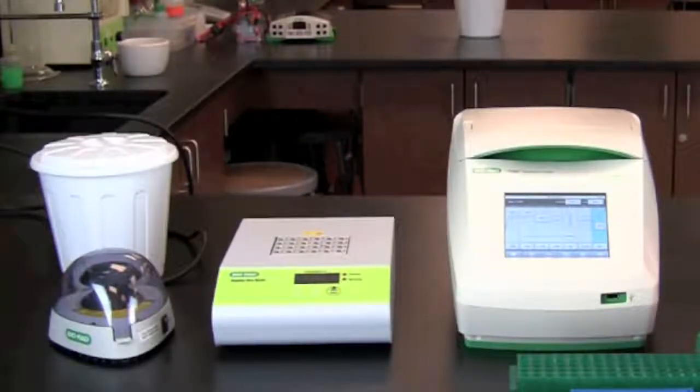In this video, you will learn how to perform an ALU PV92 detection by PCR. In this activity, template DNA will be extracted from cheek cells and PCR reactions will be set up using the extracted template DNA.